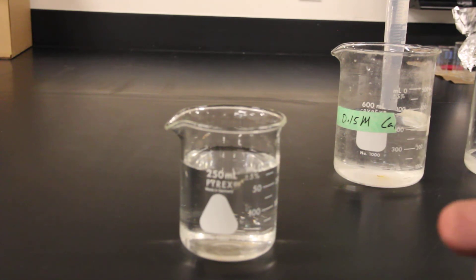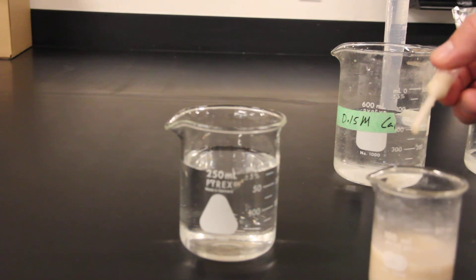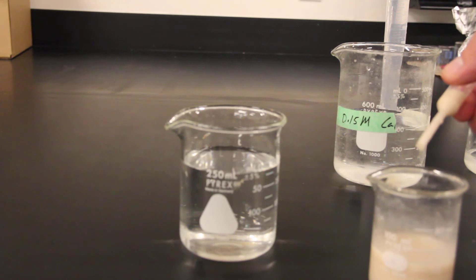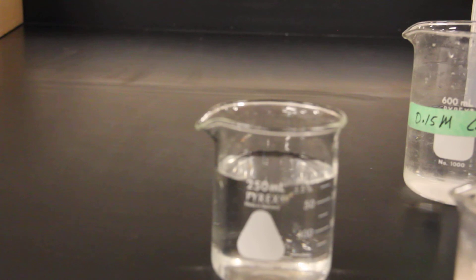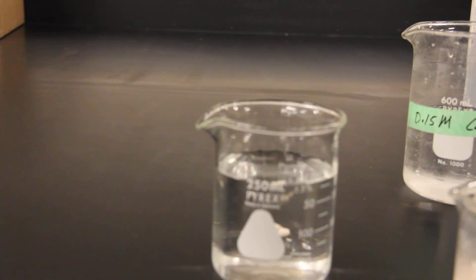Since we're not doing this for culinary purposes but for enzyme assay purposes, that'll be okay. So then what you do is take that solution of sodium alginate and yeast that we just made. I cut the end off of a transfer pipette and I'm going to slowly but steadily drop that solution into the calcium ion solution, and it should make nice regular round spheres.